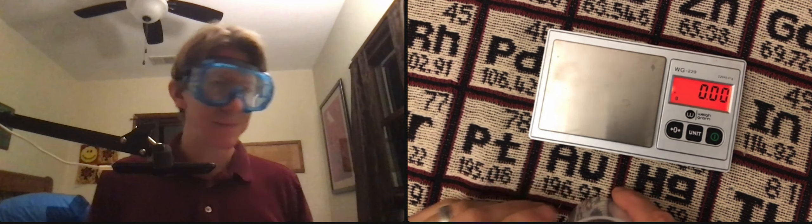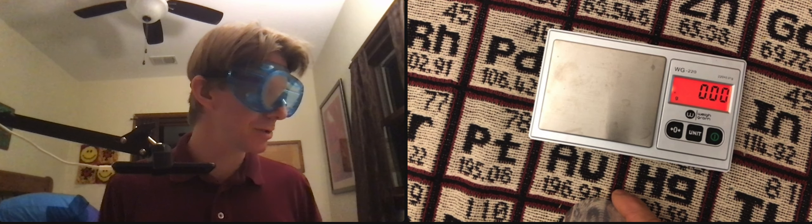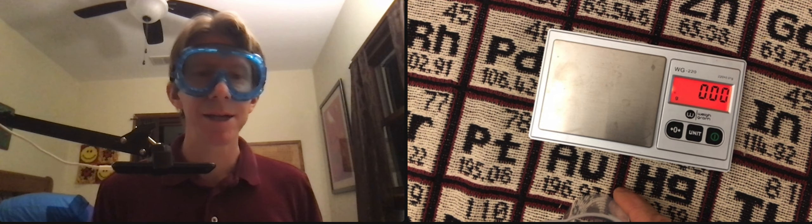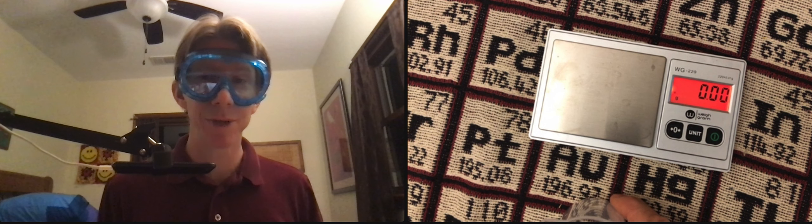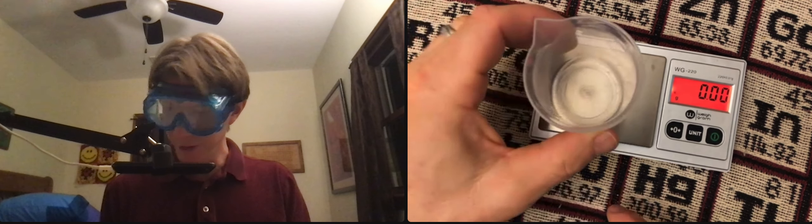Now that we've done some mashing of the eggshell and the vinegar, let's go on to preparation of the sodium bicarbonate or sodium hydrogen carbonate aqueous solution. We're going to record the mass of the 100 milliliter beaker.